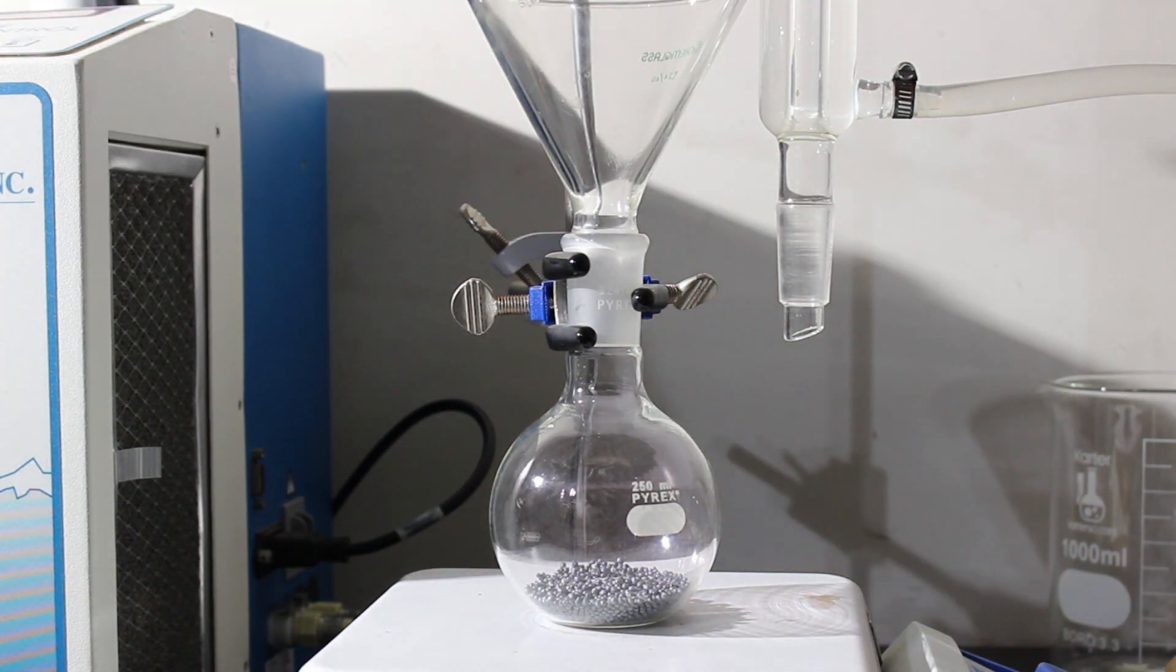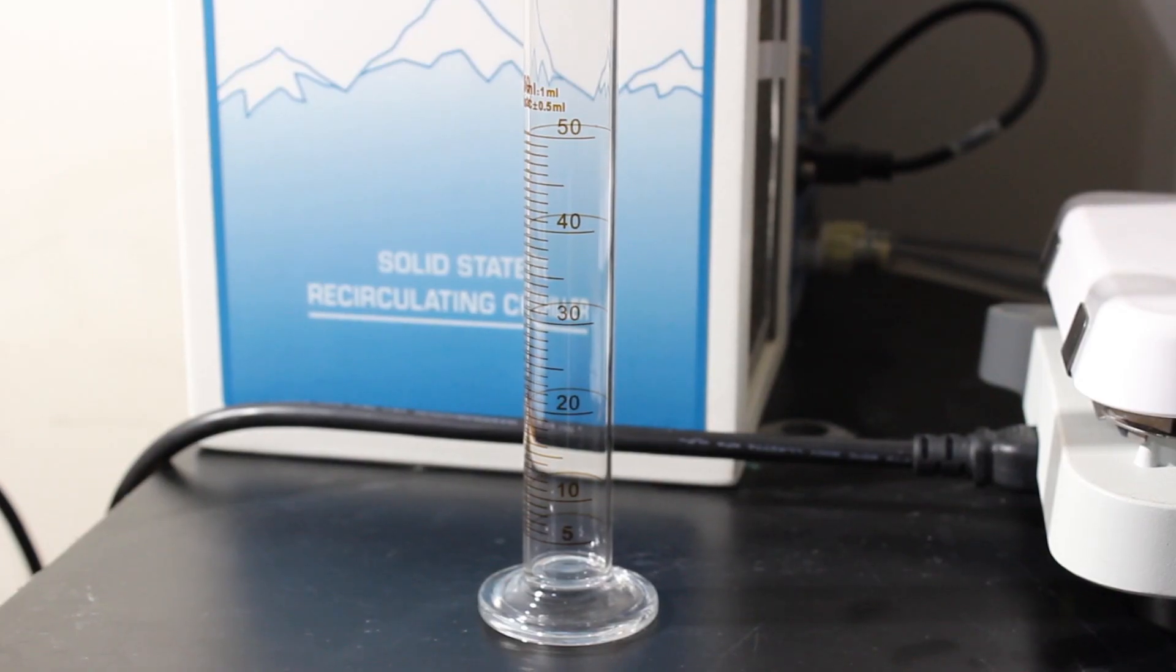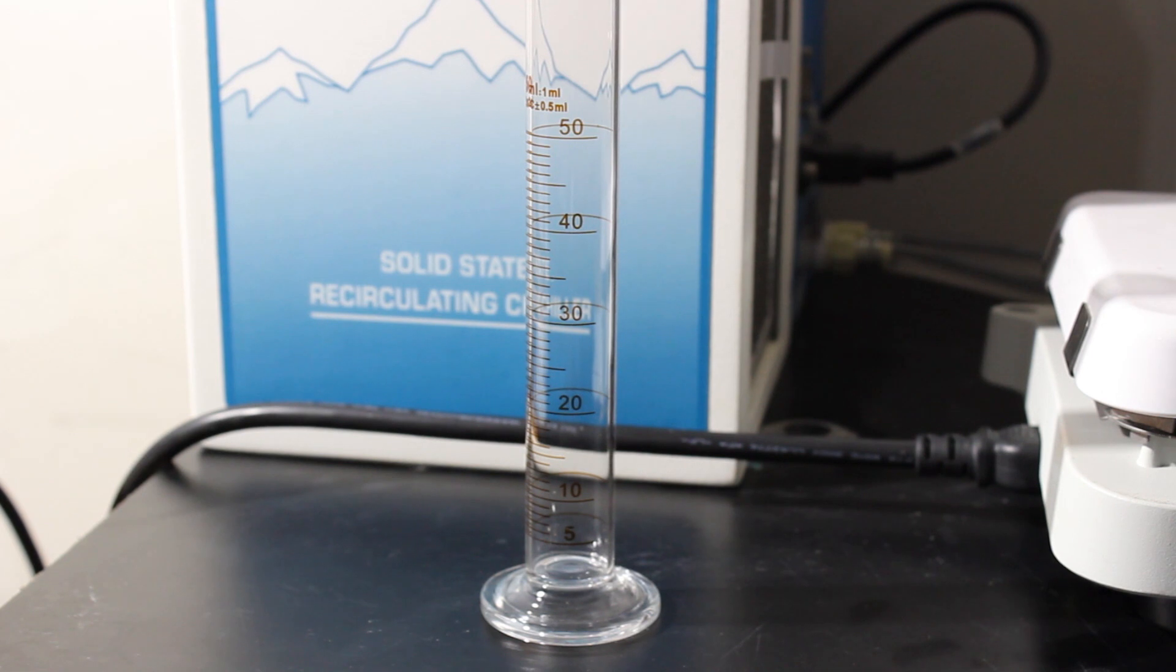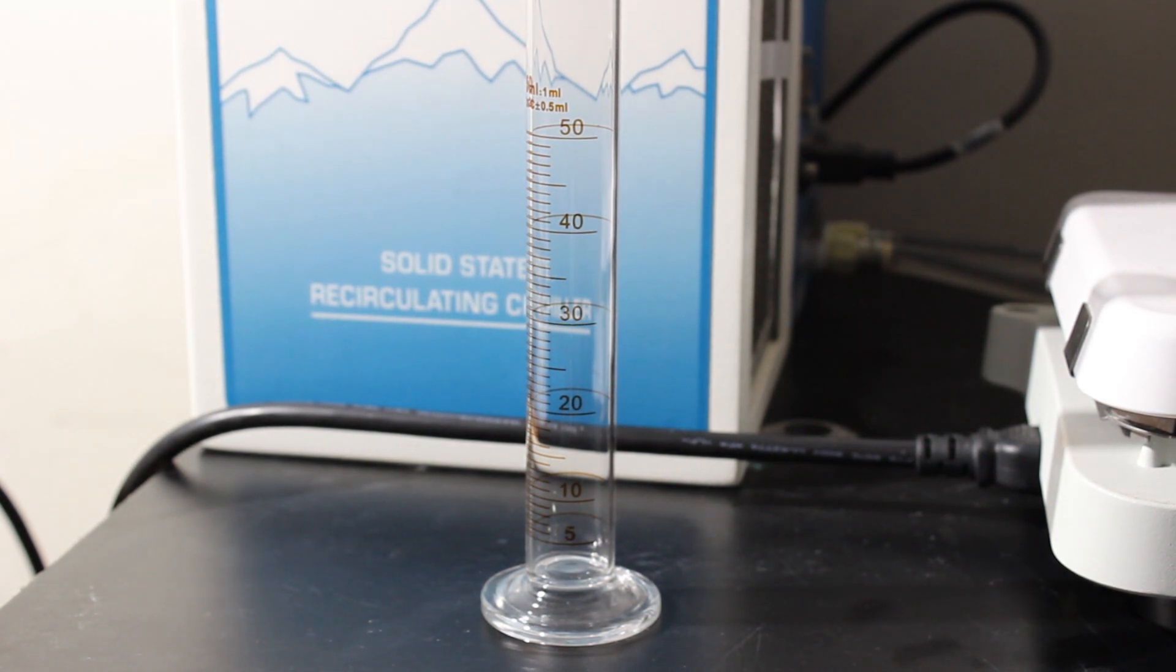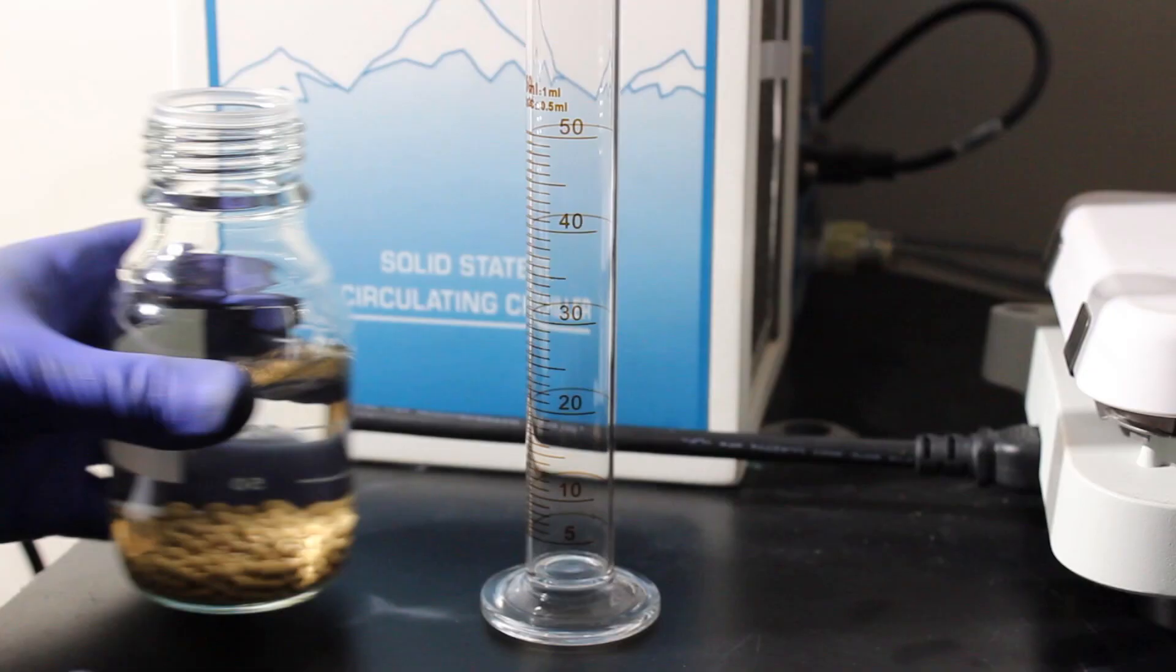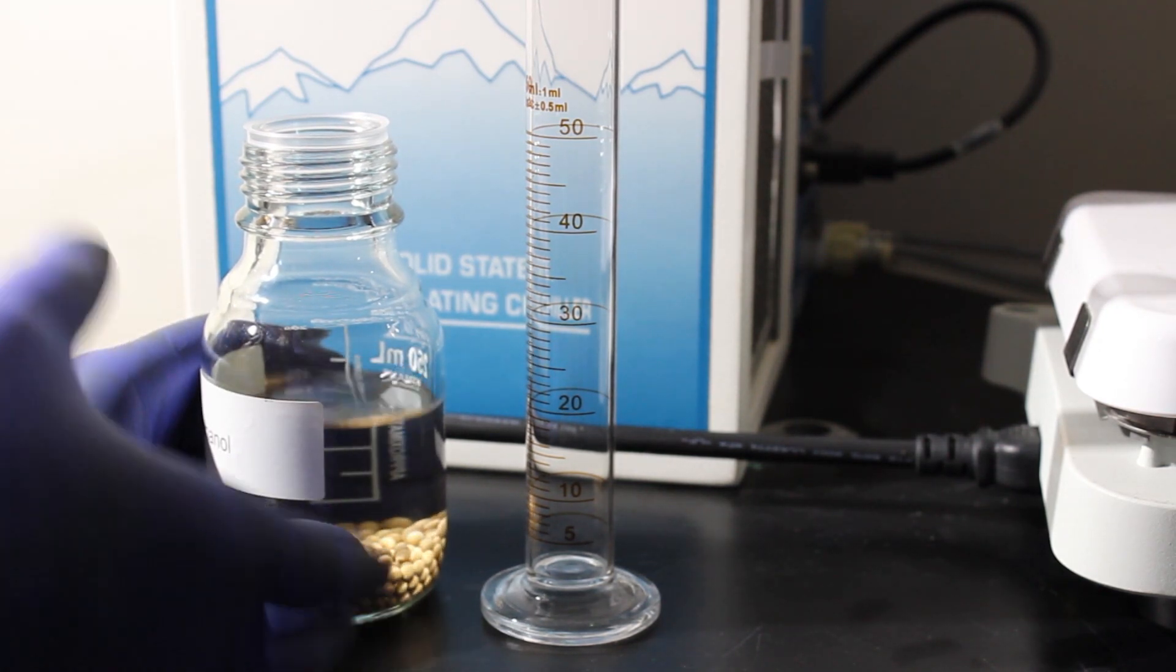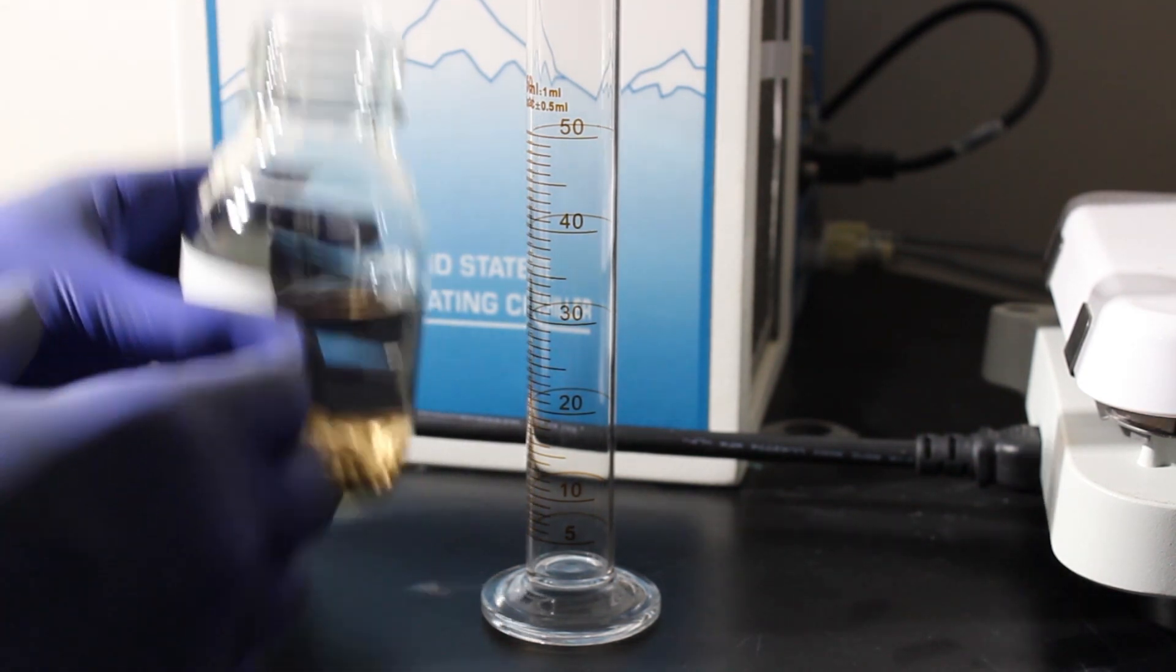We will add the methanol and then the aluminum foil. According to what I have from Chem Player, they use 40 grams of iodine and 50 mils of methanol. There should be much less needed stoichiometrically, but we're doing an excess here because this reaction is supposed to be exothermic and we want some excess solvent to consume that heat so the reaction isn't a runaway.